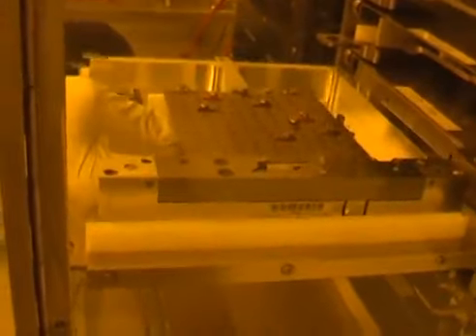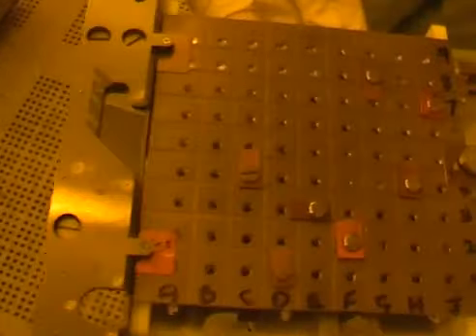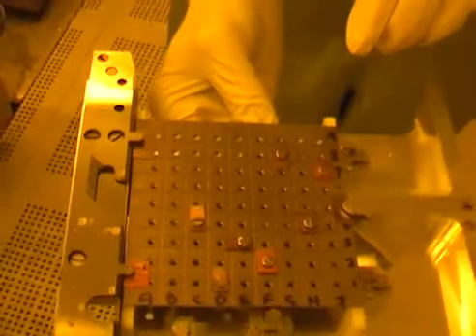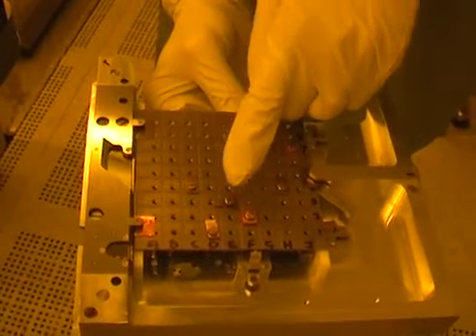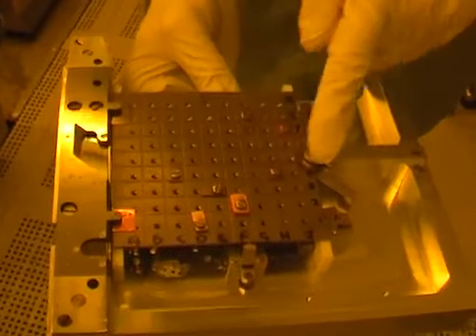So next job is to get the correct holder. So we can come across here. Now remember, this is an 800 micron thick small piece, so I'm going to use this particular holder here. This is set up to take small pieces. And all it is is a 4-inch plate with clamps on it, so we can clamp the sample, and height references which we can change the thickness of.